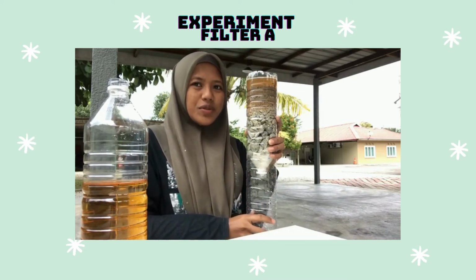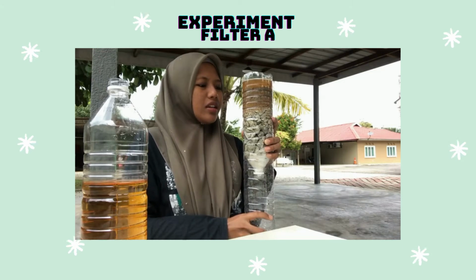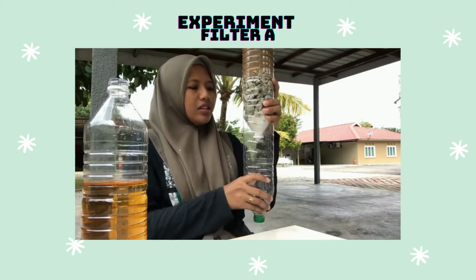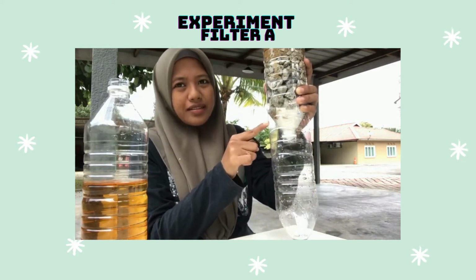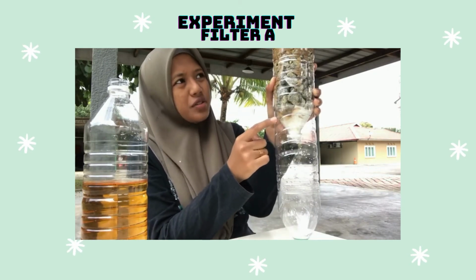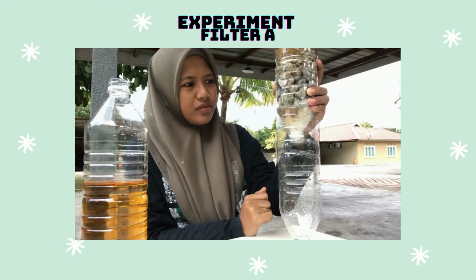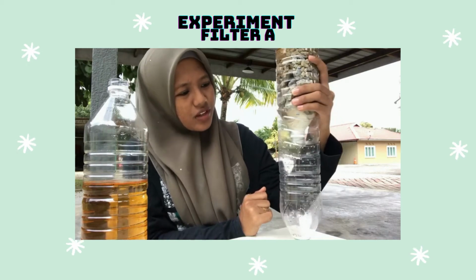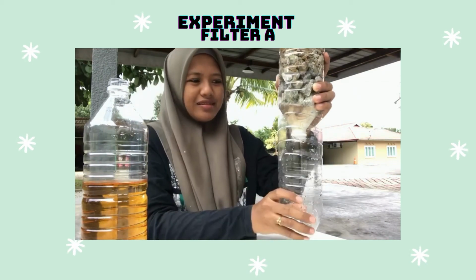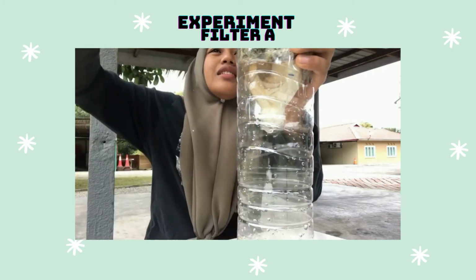Let me show you this one, like this. So we still wait for the water to drop. Now the water drops at the cotton pad. Yeah, if you see. Okay, the water starts going down. Now we add more.